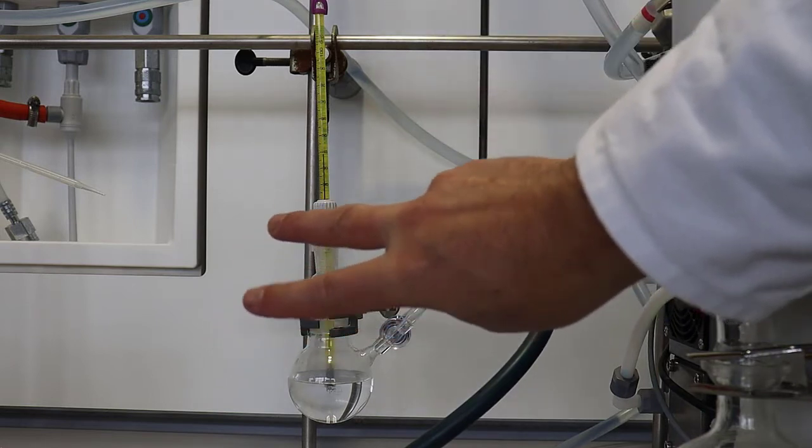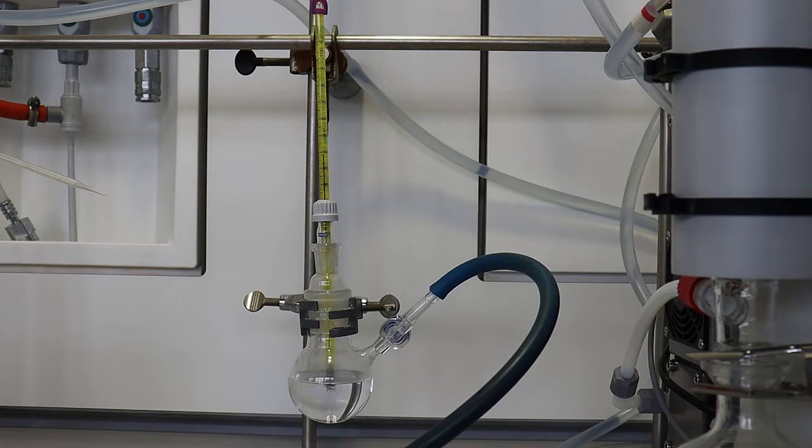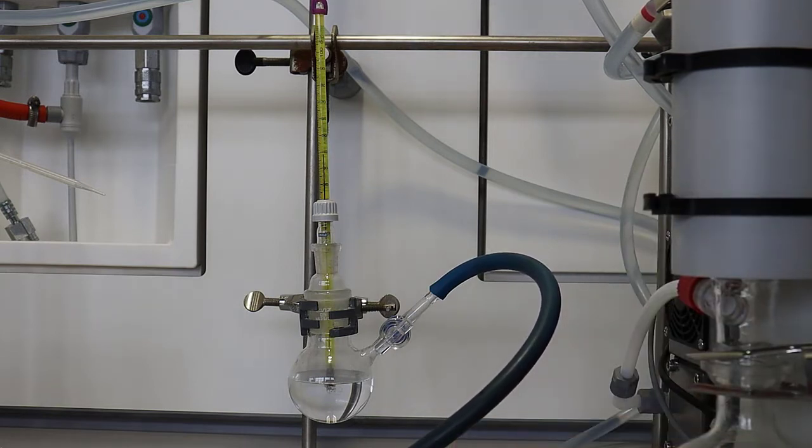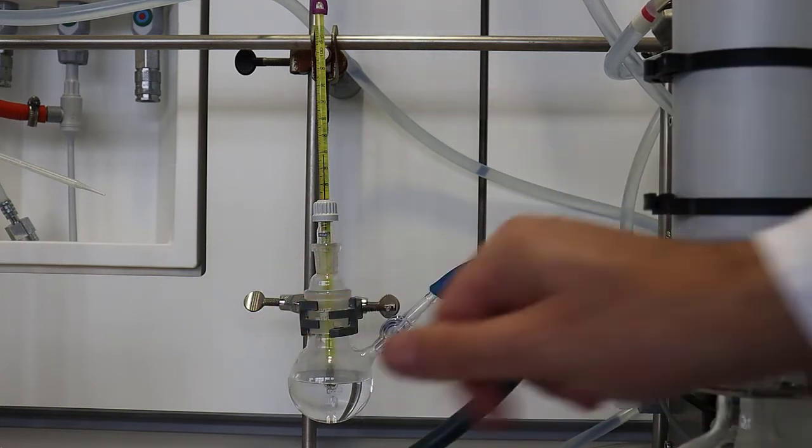So now we're at 300, 200 millibar, 0.2 of an atmosphere and still nothing is happening. It's not surprising, we're quite far below the boiling point of water and the temperature is not going up. It's not heated, it's just going down slowly. You can see probably it's 39 now.